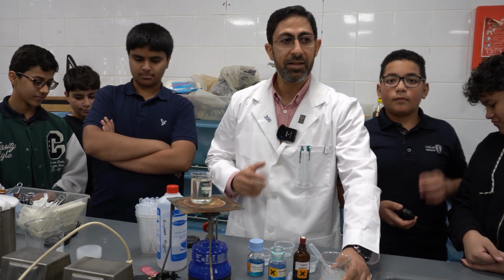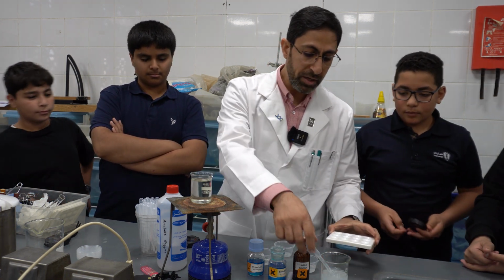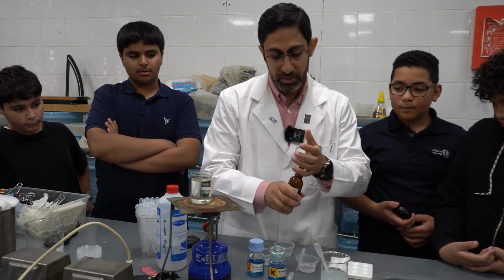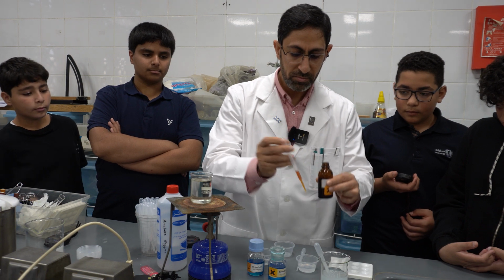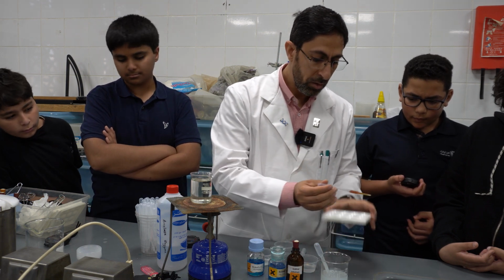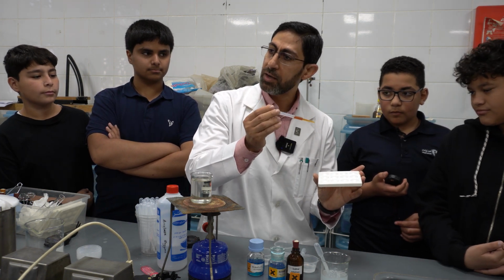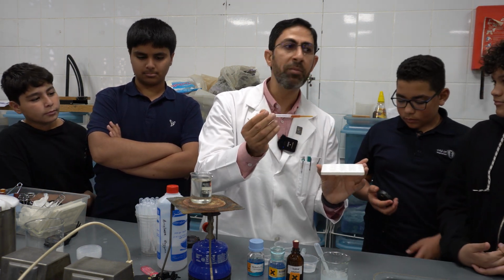And as you know, the test for the presence of starch is the iodine test. In order to do so, we will take a drop of the unknown, put one drop in the spotting tile, and then take a drop of the iodine solution, one drop of the iodine solution to the colorless unknown, to be sure whether it's starch or not. If it's a positive result, the brownish color of the iodine will be converted into blue-black. If it's a negative result, the brown color will remain unchanged.